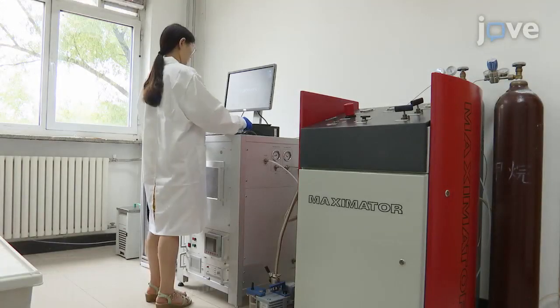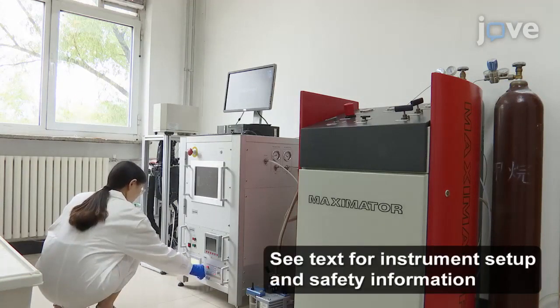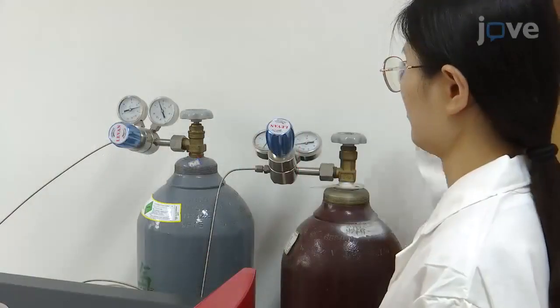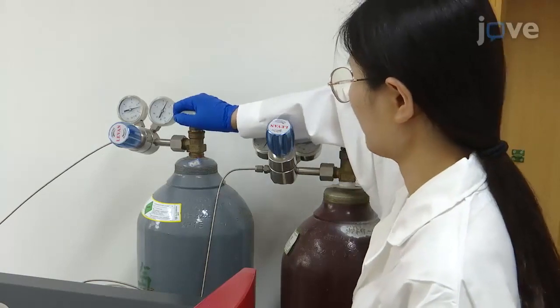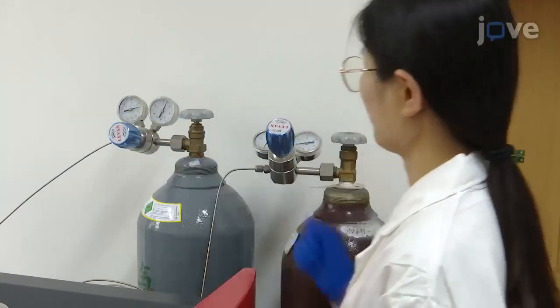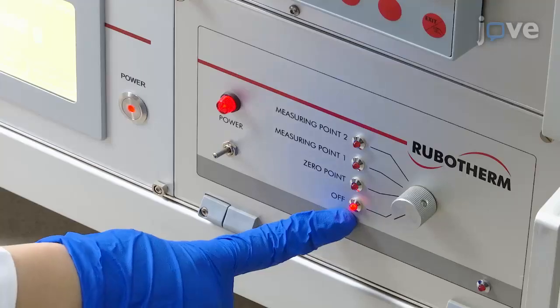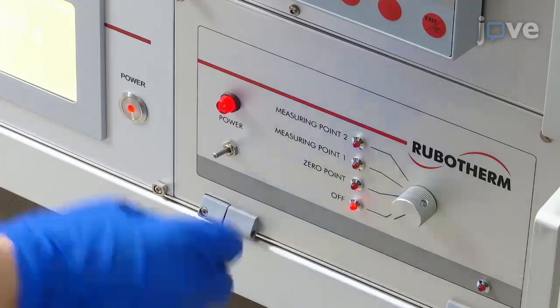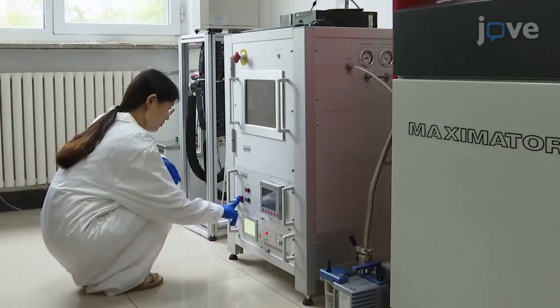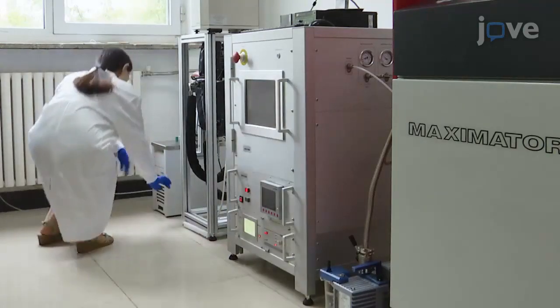First, turn on the magnetic suspension balance computer and start the magnetic suspension coupling controller. Open the gas 2 helium cylinder and roughly adjust it to the appropriate output pressure with the control valve. Next, confirm that the magnetic suspension coupling controller knob is in the off position. Then, turn on the instrument temperature controller, the oil bath heater, and the vacuum pump.